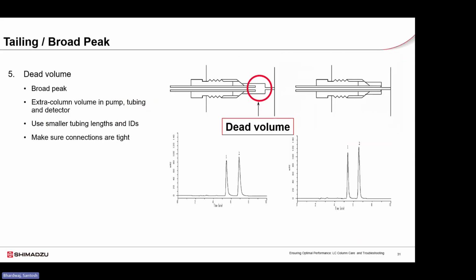Extra column dead volume is a common cause of peak broadening. It occurs when there is long or wide tubing, loose connections, or a large detector flow cell, all of which increase the band dispersion before reaching the detector. To minimize this effect, use short or narrower tubing. Ensure that all connections are properly tightened, firm but not overtightened, especially at the column outlet. Dead volume issues are more pronounced in UHPLC systems as they are much more sensitive to even a small increase in extra column volume.